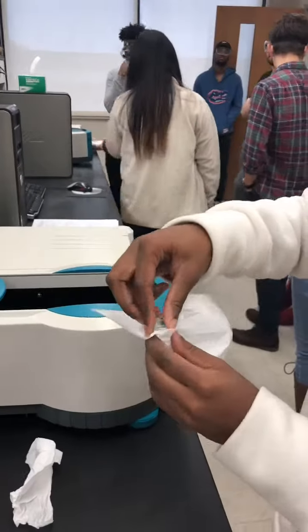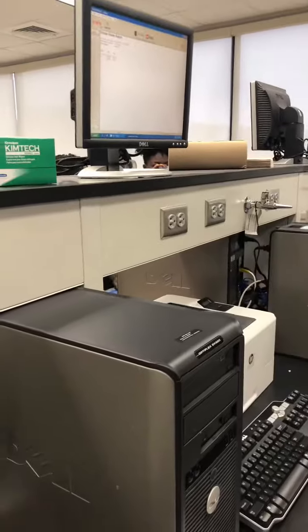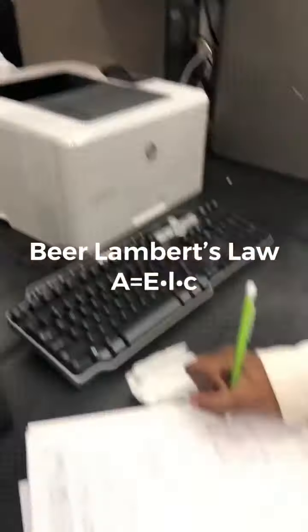All of the absorbances that we have found so far are recorded into the chart. The chart will be used to find slope and fill in some of the blanks in the Beer-Lambert law. The Beer-Lambert law is A equals ELC.